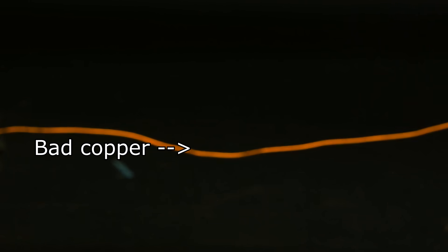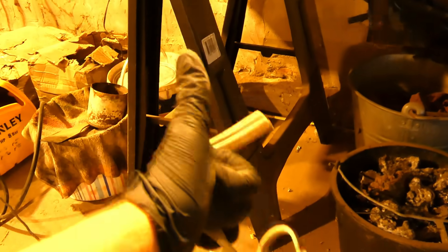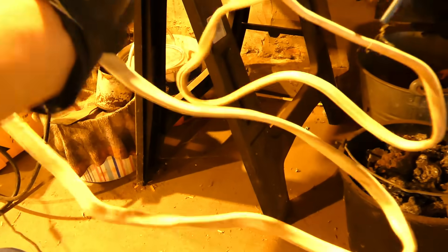OK, so to construct the mercury making contraption, I first had to find some copper. Unfortunately, my metal stash was almost completely devoid of it. All I had left were just some old copper wires covered in a thin layer of very rigid plastic insulation. I couldn't use them because the copper had to be completely clean. After some searching, I found this old piece of cable that looked like it had some delicious pure copper in it. To check if this was the case, I got rid of the insulation, and fortunately, this copper was just the thing I was looking for.